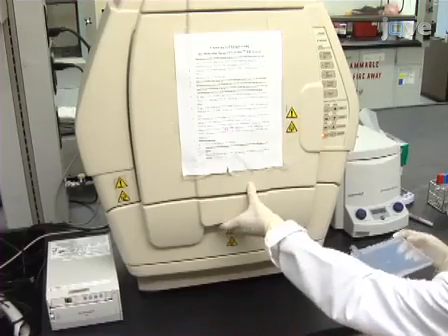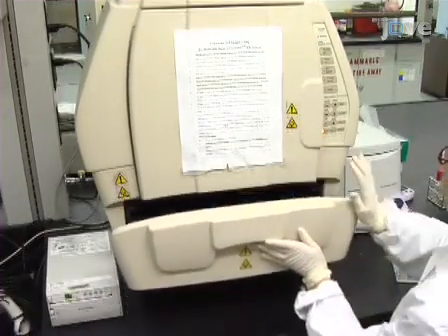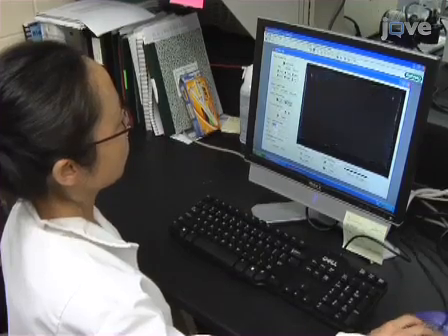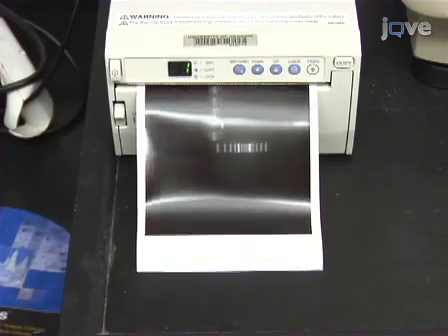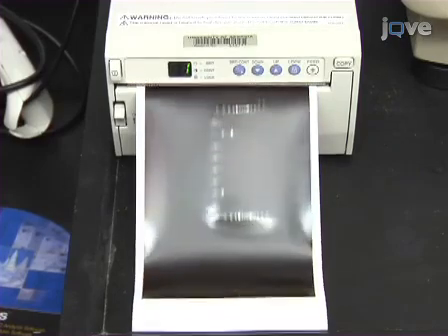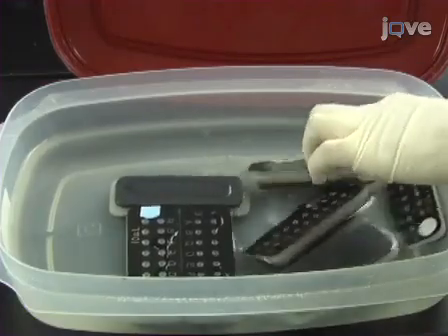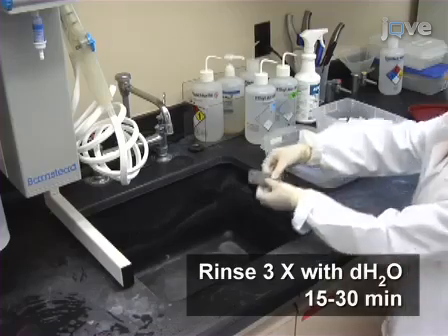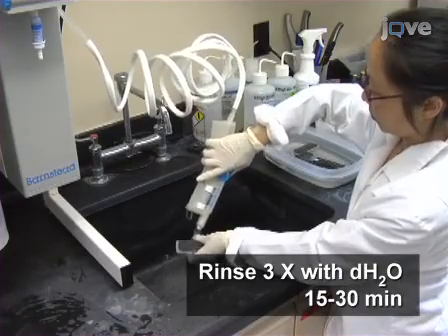Upon completion of electrophoresis, transfer the gel to a UV transilluminator to visualize DNA fragments and molecular weight standards. Capture images on a GelDoc XR system. Finally, place the capillary holders in 10% bleach for 15 to 30 minutes. Rinse 3 times with distilled water and place back in the PCR setup room to air dry.